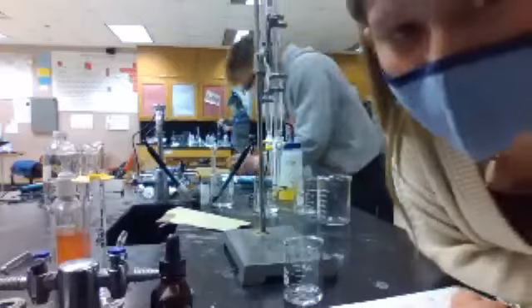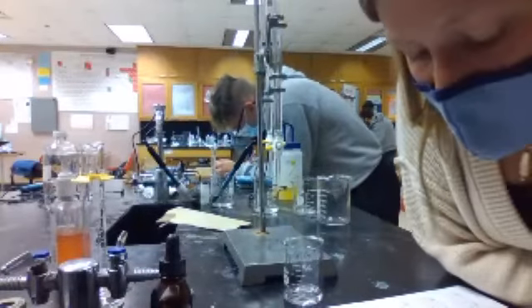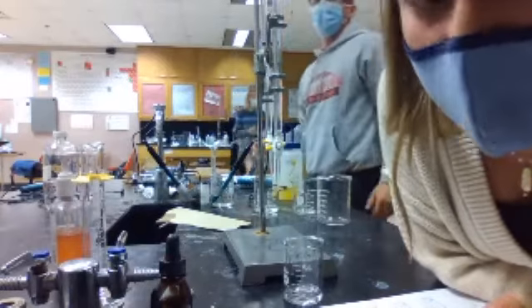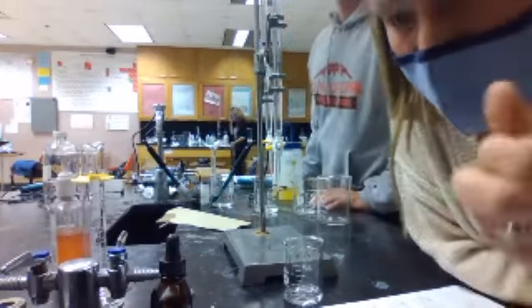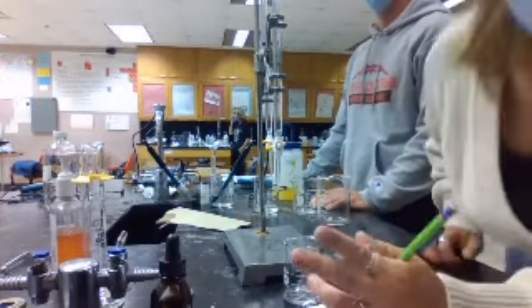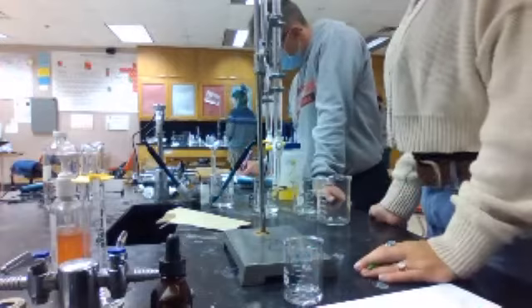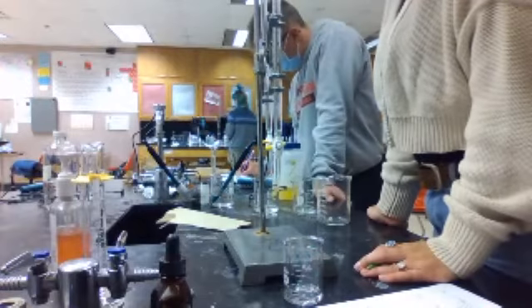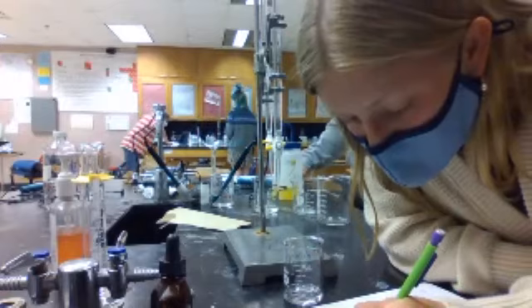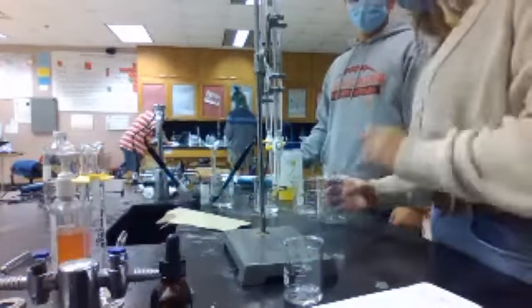Okay. So for trial number 2, for unknown number 1, the initial volume of the base is still 9.99 because we start with the same one, if that makes sense. And then the initial volume of the acid is 9.99, the same one. They're at the exact same spot. Okay, so then I take 10 milliliters.